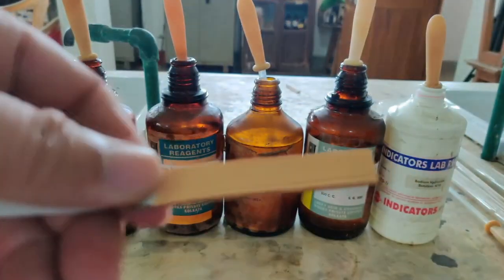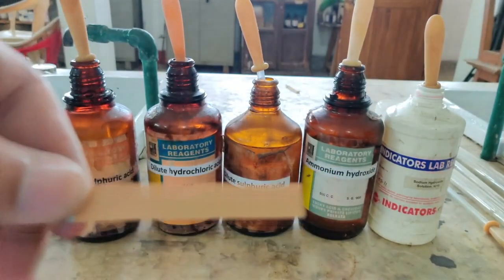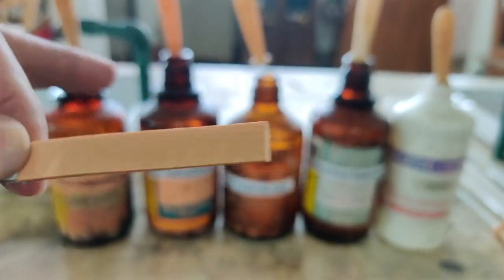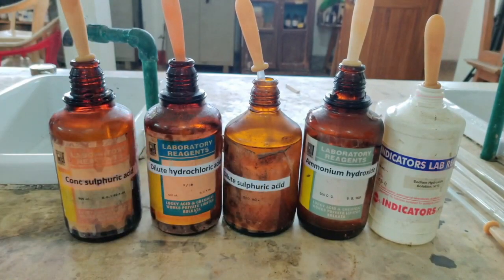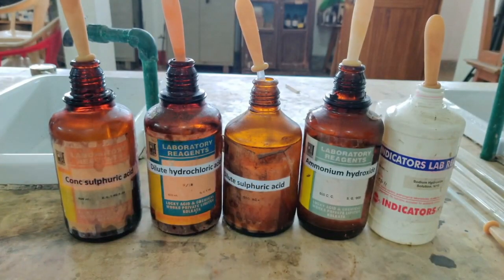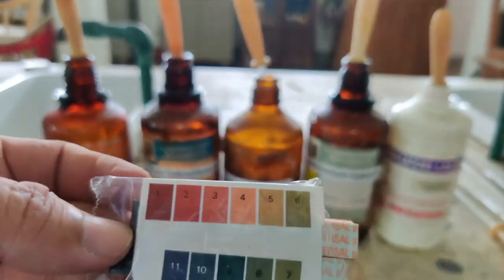Last time when I was teaching you theory, I was telling you about this too. By the way, it is neither red litmus nor blue litmus. So it is your universal indicator, containing many strips of paper. By looking at the color change of this paper only, you should find out what the pH value is. It will take a little time to dry, but let me tell you how to compare the pH.